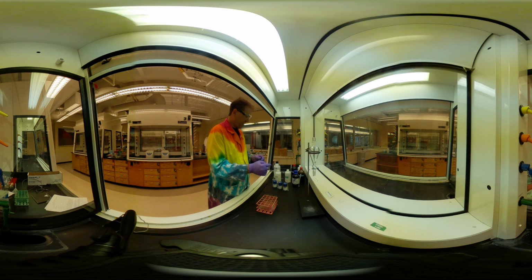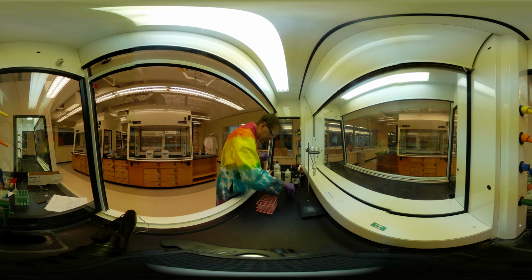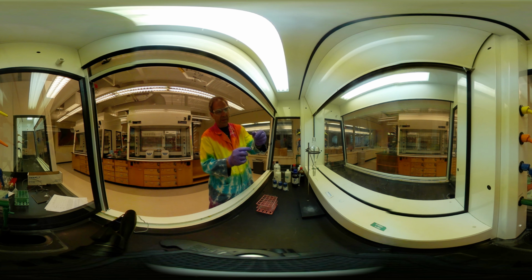I didn't get quite as much solvent in that one. I'm going to add a little bit more to it. Leaky pipettes today.